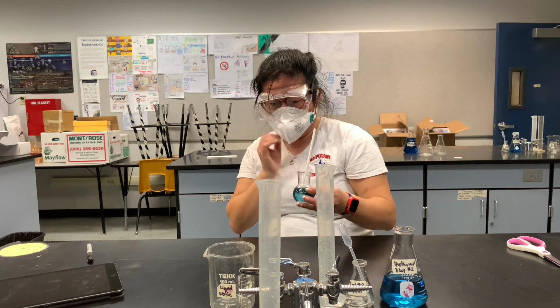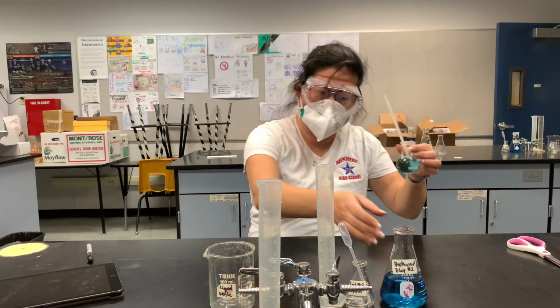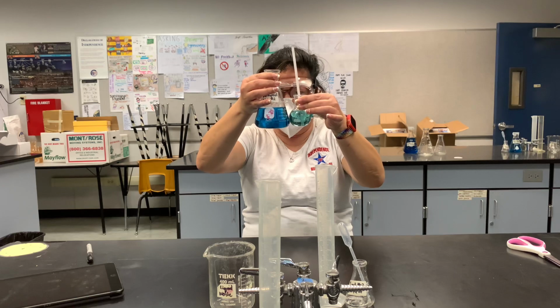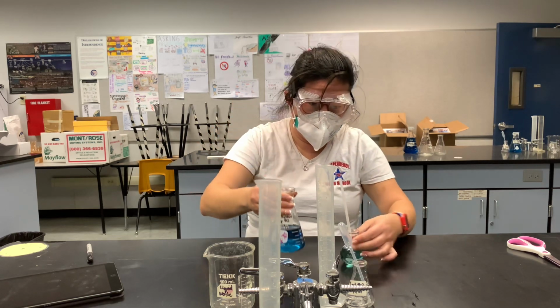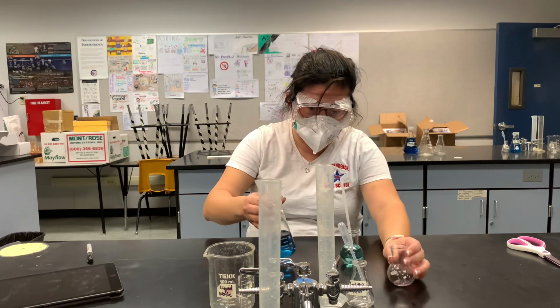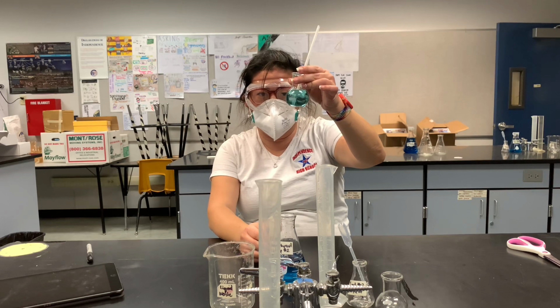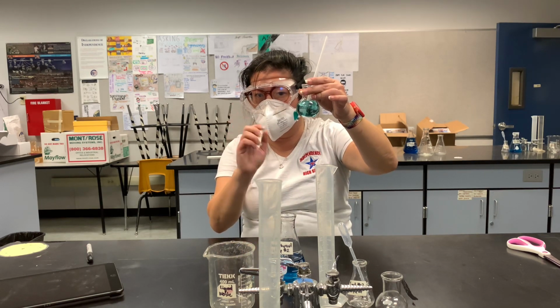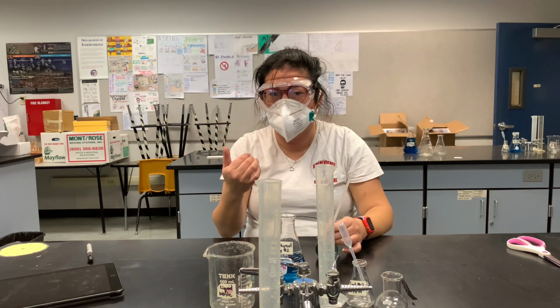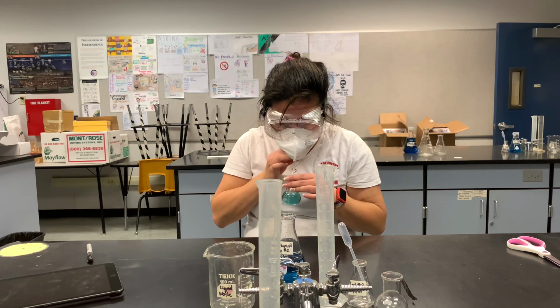That was 5 seconds, and then I'm going to note the color. How do I know the color has changed? You're going to compare it to your solution from before. Ideally, you want a solution to compare to with another group. So you have to figure it out, write down the color, compare it to the color that's on your lab paper, and then you're going to keep on doing it. Do another 5 seconds for the second one.